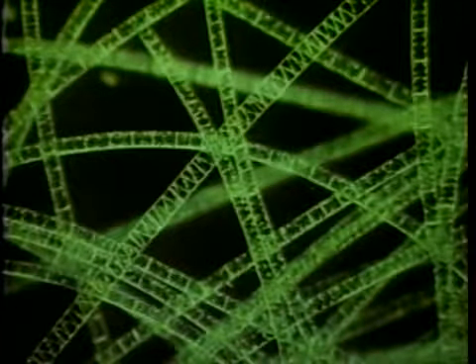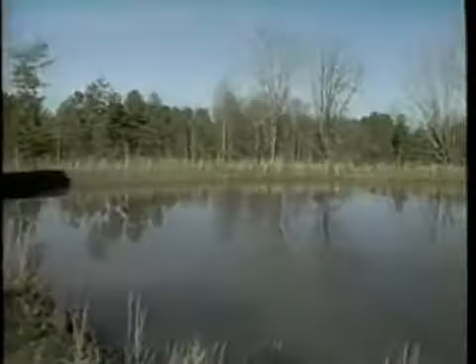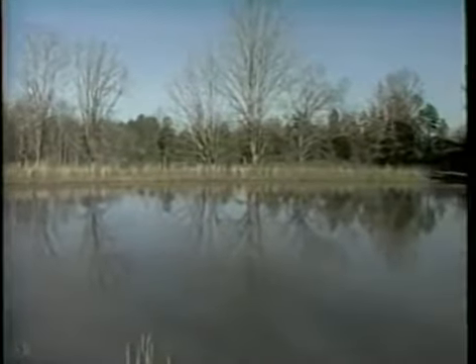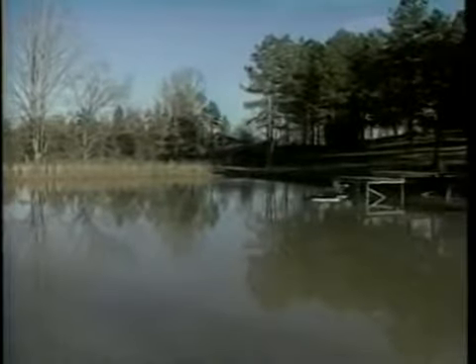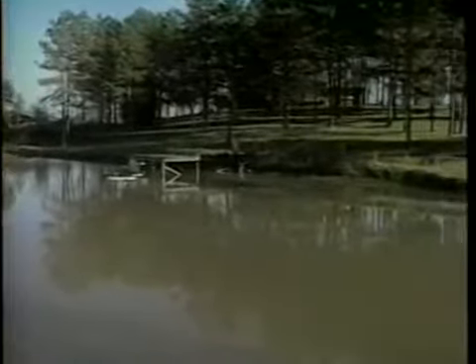The principle behind the Secchi disc is that it correlates with the turbidity in pond water, and since turbidity in most fish ponds is due to phytoplankton, the Secchi disc is a good indicator of phytoplankton abundance. However, in some ponds, turbidity may be due to suspended clay. If this situation exists, the clay must be removed to ensure phytoplankton growth. Consult your county extension agent or aquaculture specialist if this problem exists.